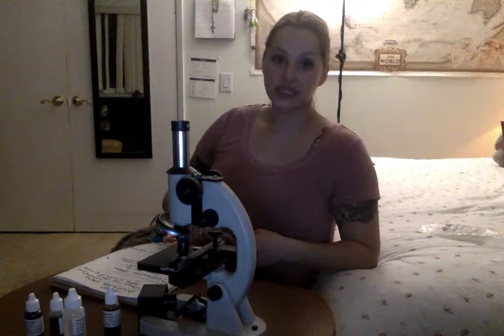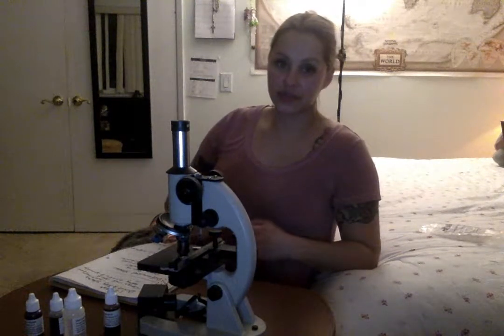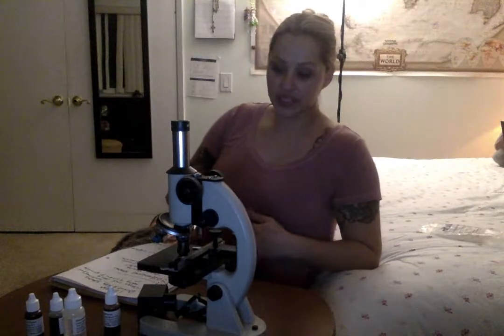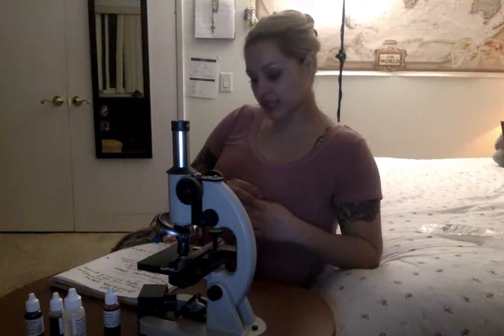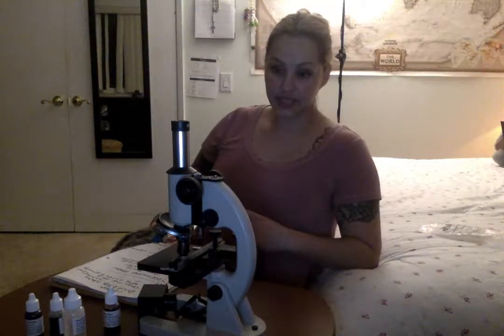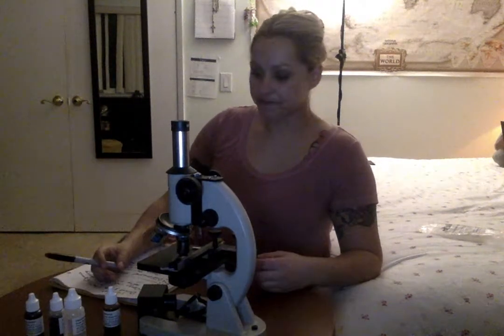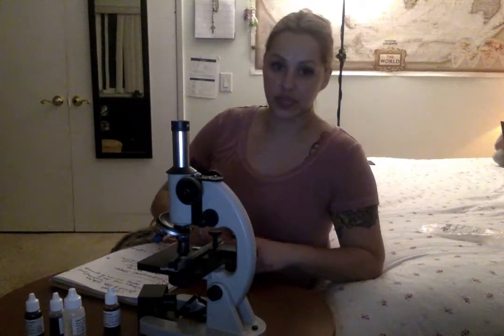The date is Sunday, January 28th, 2018, and this is week 3 of microbiology. This week, we discussed bacterial morphology and staining techniques. For this week's video, I took out some of the equipment that we used, because I just wanted to go over the labs.